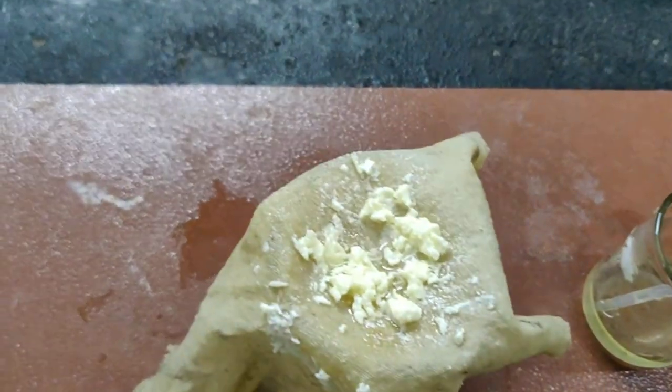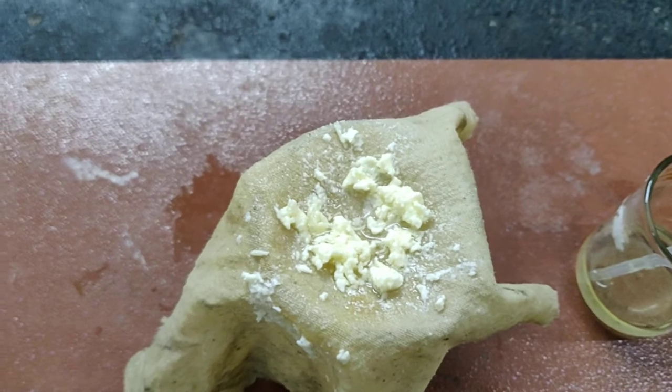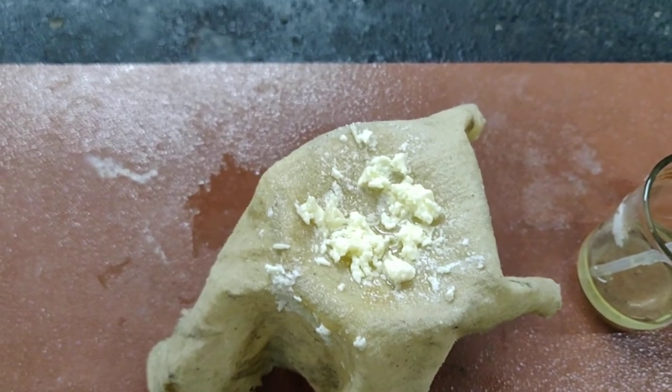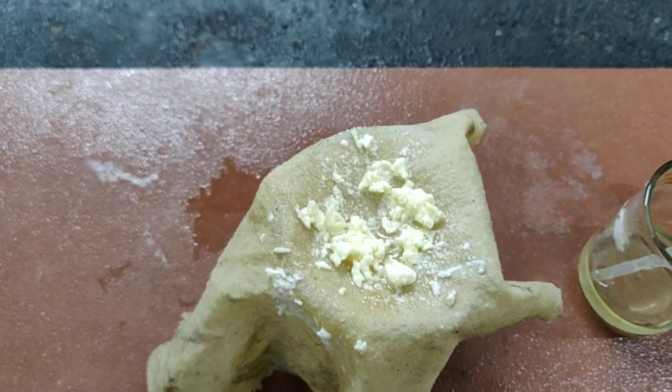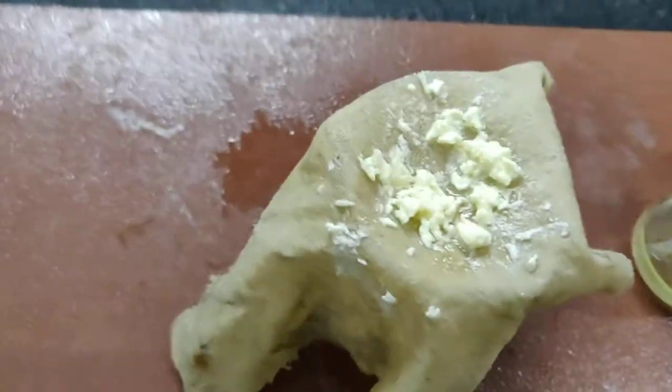And then once again, you are supposed to squeeze it to dry. And then weigh it after it is 100% dry.